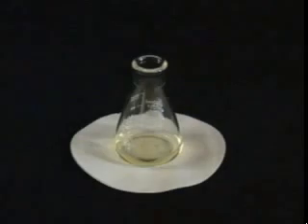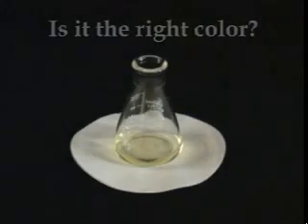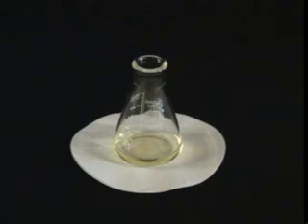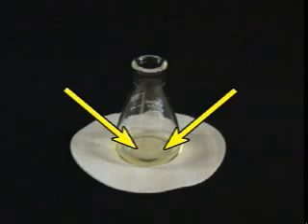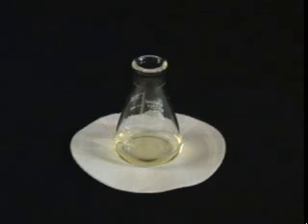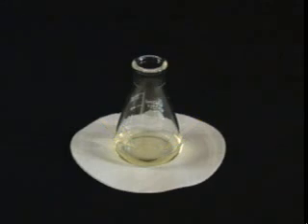Caution! If it won't dissolve, it's probably an impurity. Now that the sample is in solution, impurities can be removed through decoloration and hot filtration. Take a close look at the solution. Is it the right color? For example, if you're expecting white crystals and your solution is yellow, then there is a soluble impurity. One easy way to remove small amounts of colored impurities is with activated charcoal.